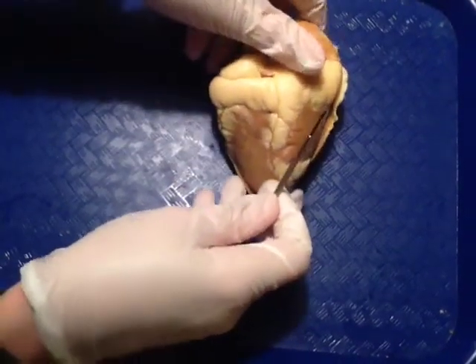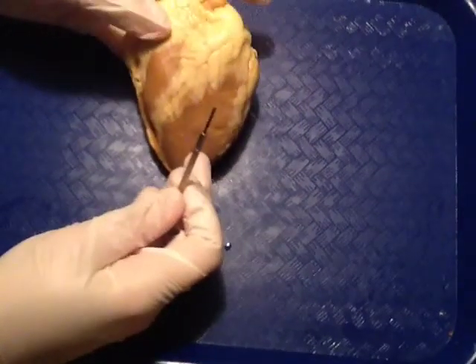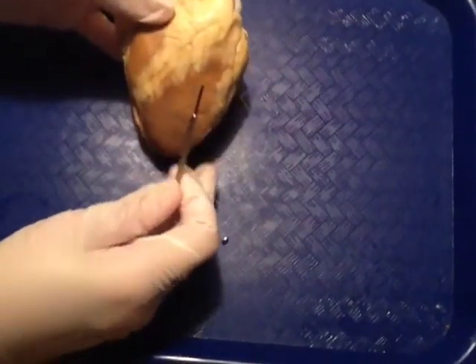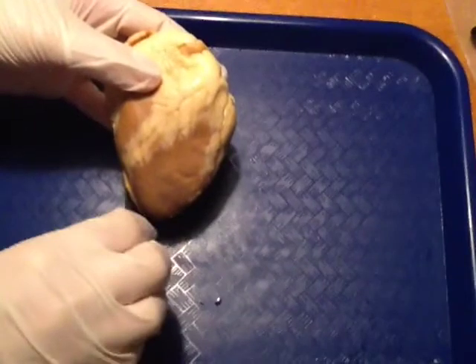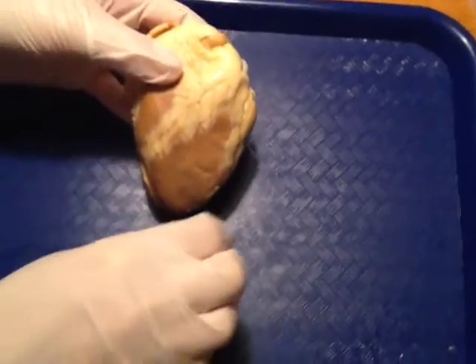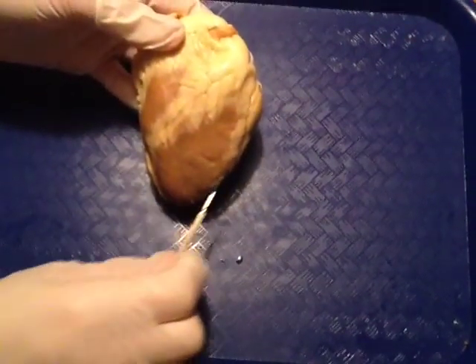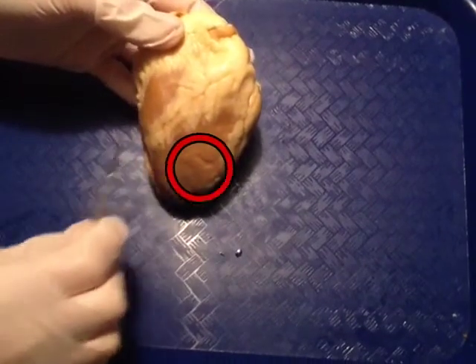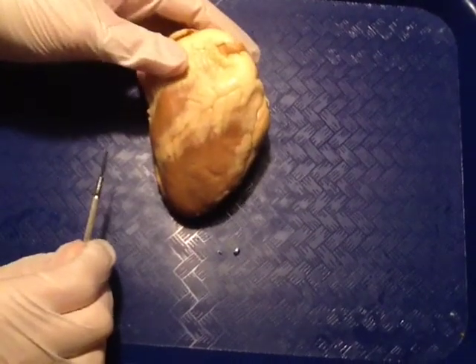Thank you for joining us for this sheep heart exploration. Looking at the outside again, just a reminder: we have the apex, and then we have the left and the right side.